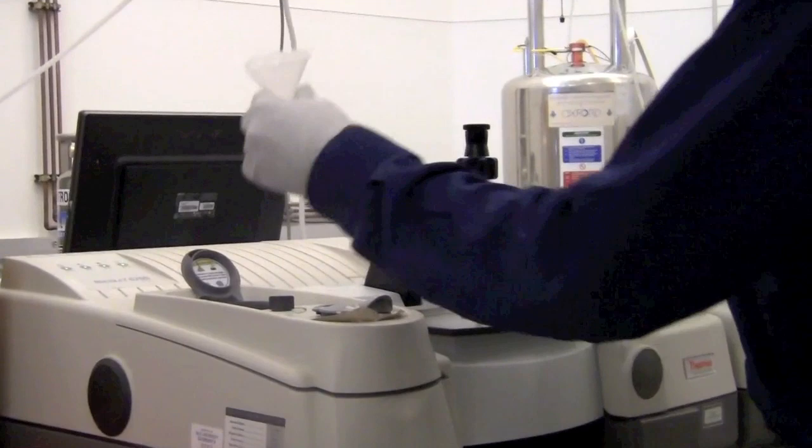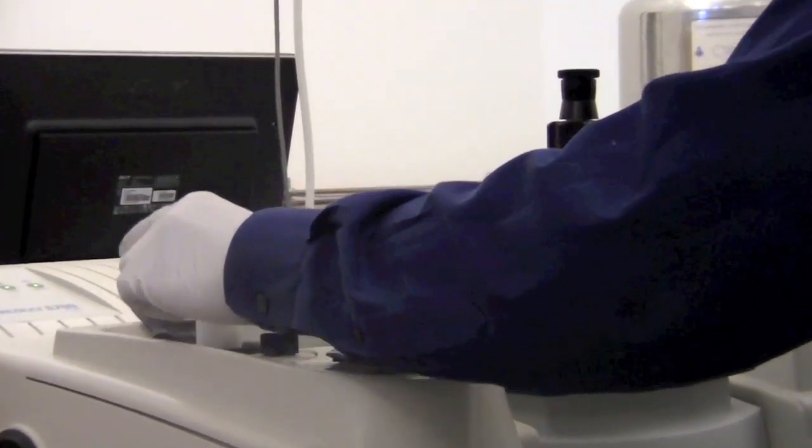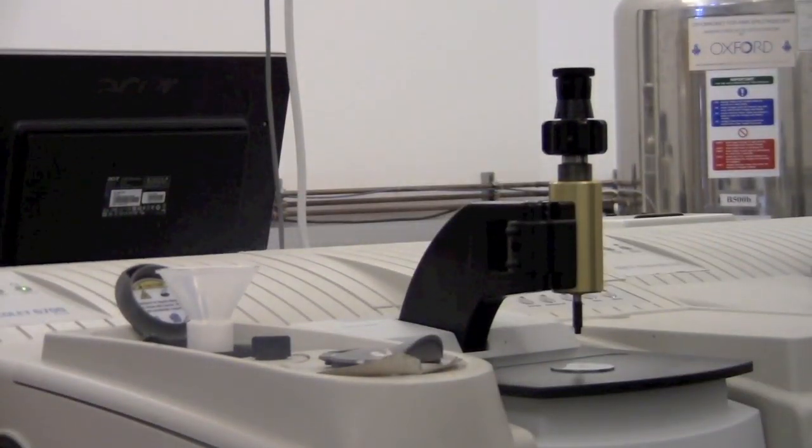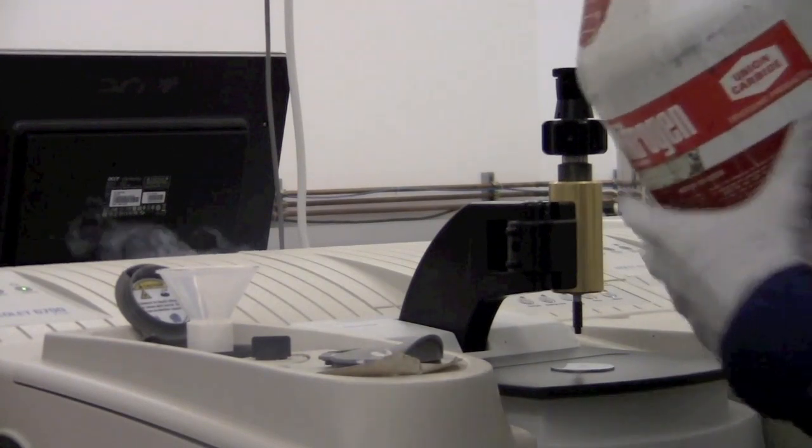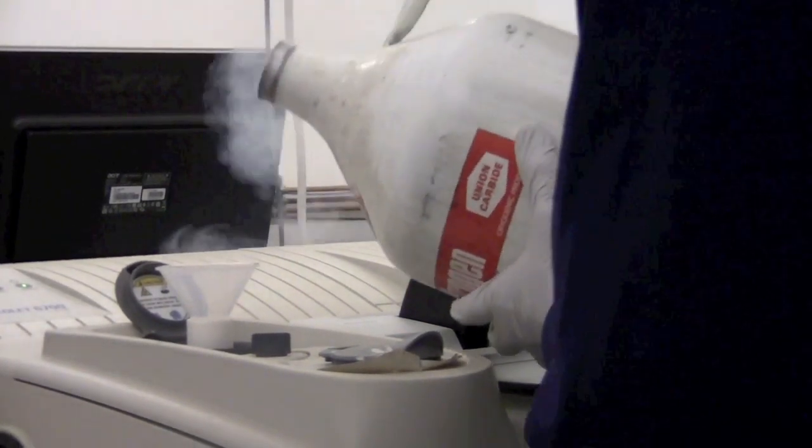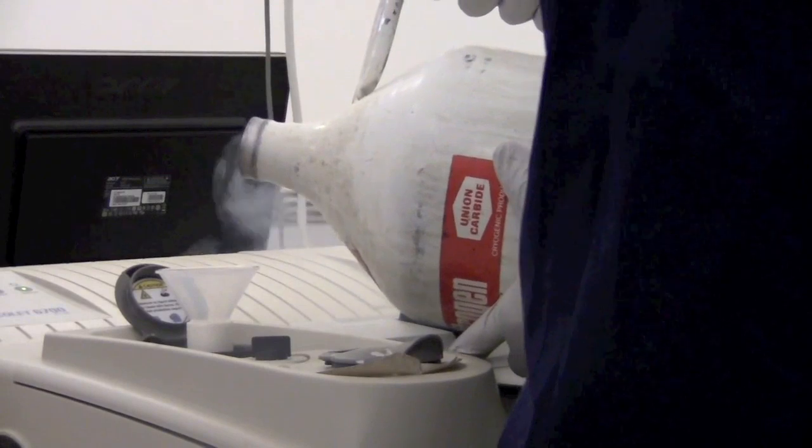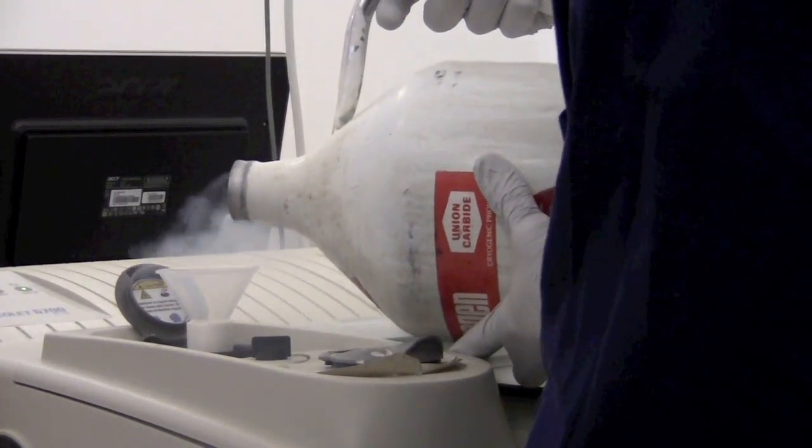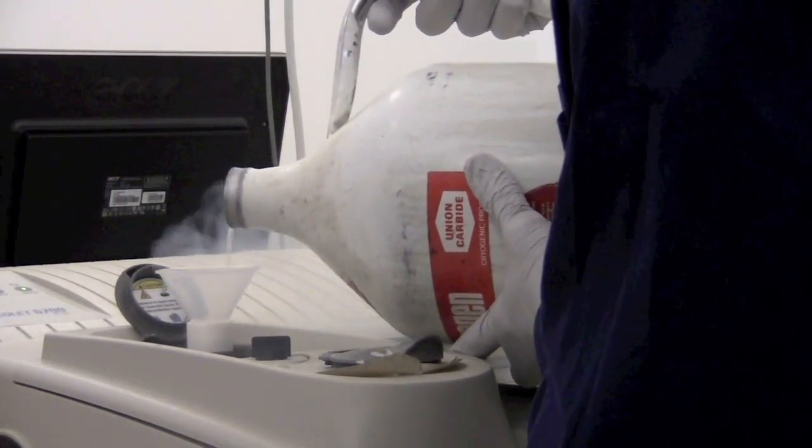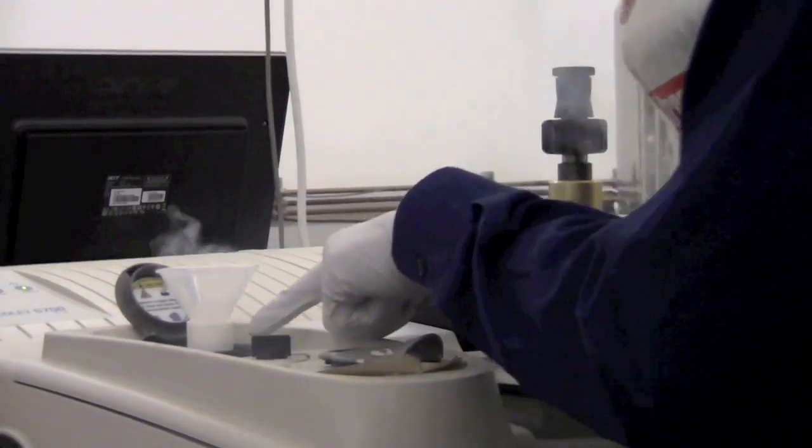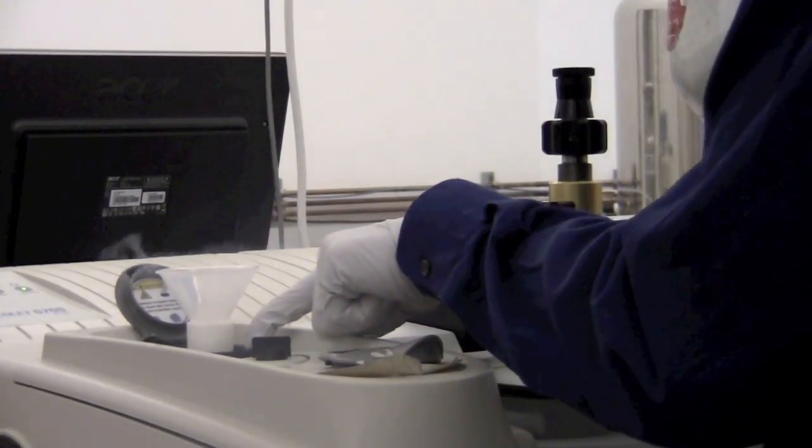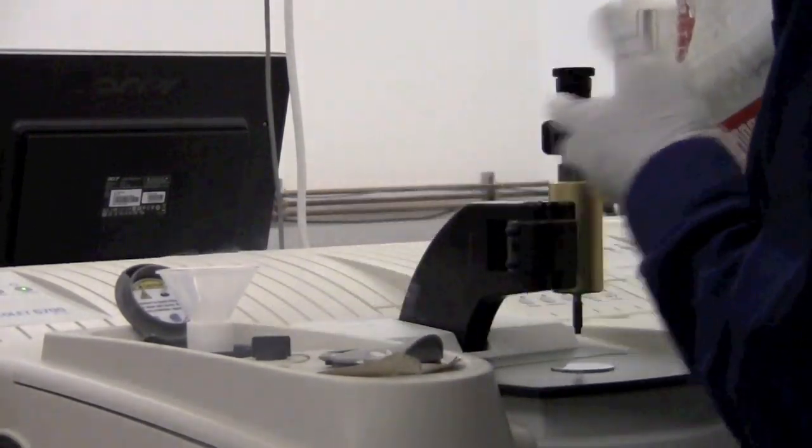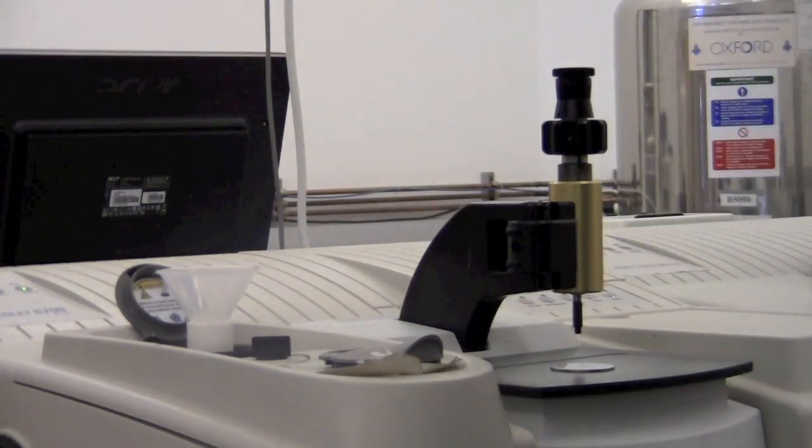You can use this funnel to add liquid nitrogen. What you would do is slowly add liquid nitrogen until it comes out at the bottom of the styrofoam holder down there. In this case, it's already full, so we don't need to add any more.